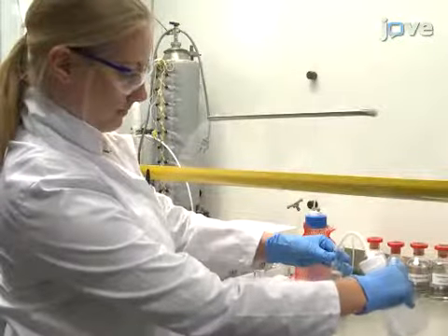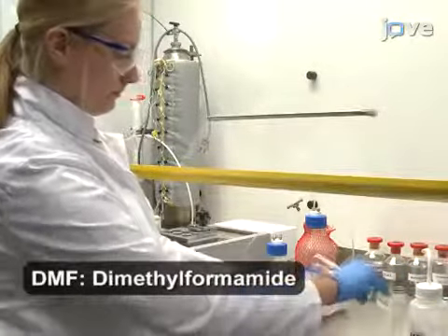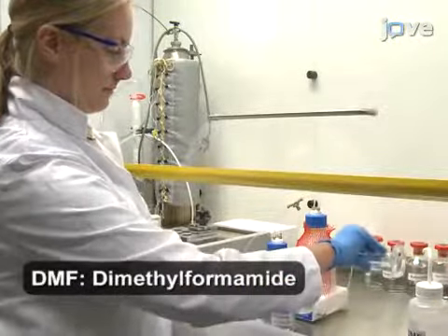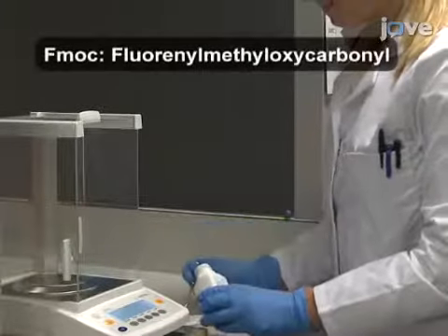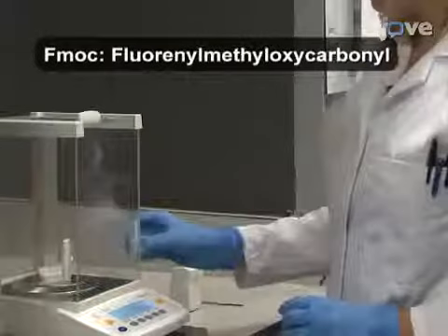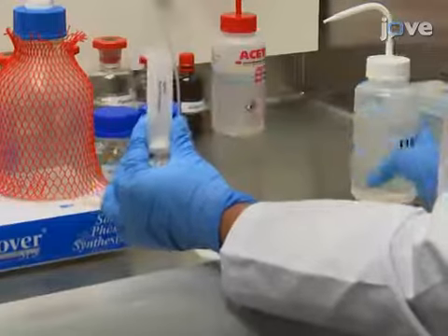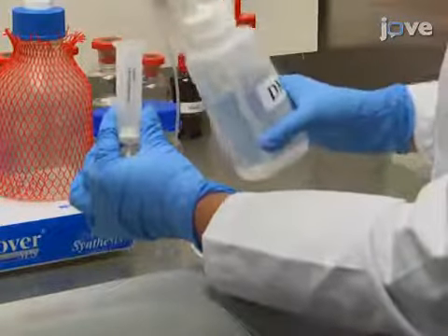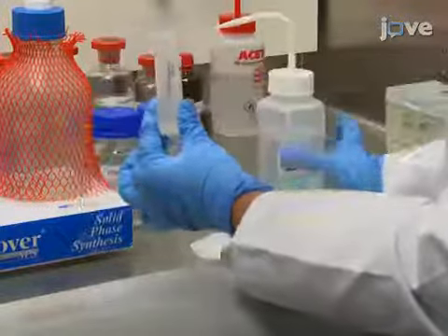To begin this procedure, prepare solutions in dimethylformamide as outlined in the text protocol. Then add 0.1 millimoles of FMOC-protected rink amide resin to a capped 20 milliliter polypropylene reaction vessel with 2 frits. Add 5 milliliters of dimethylformamide and let the vessel stand for 60 minutes at room temperature.